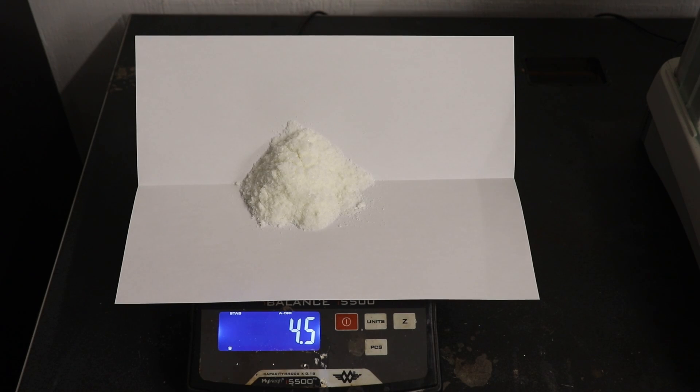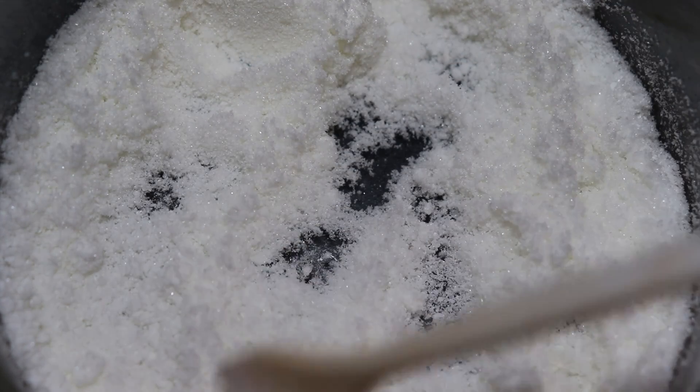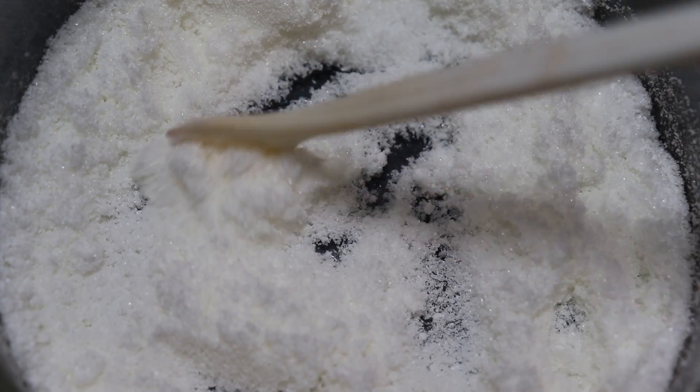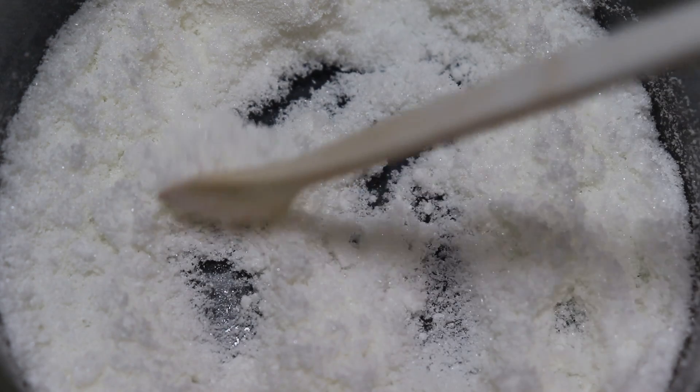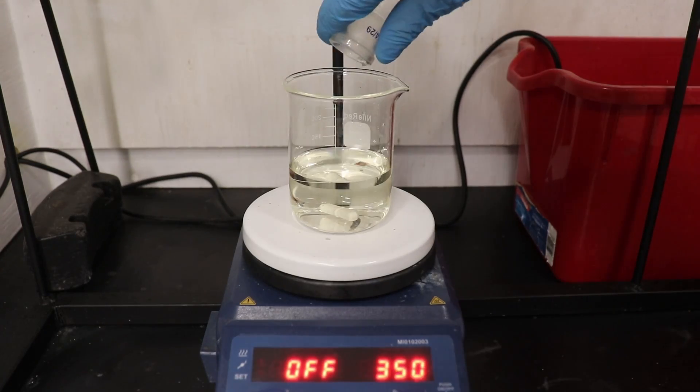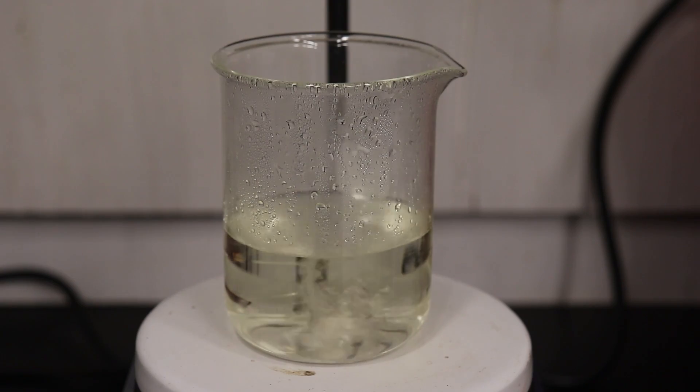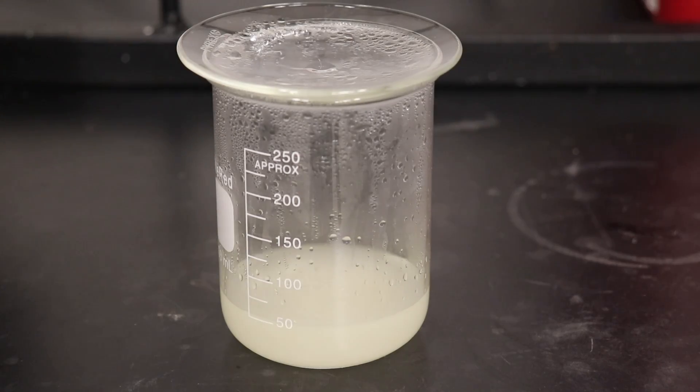Unfortunately, the product was deceivingly fluffy and only 4.5 grams of biphenyl was recovered representing a 31% yield, which is a 40% reduction from our crude yield before the recrystallization. So I figured that there was still a significant amount of product stuck in the filtrate, so I boiled it down and let it crystallize out again.